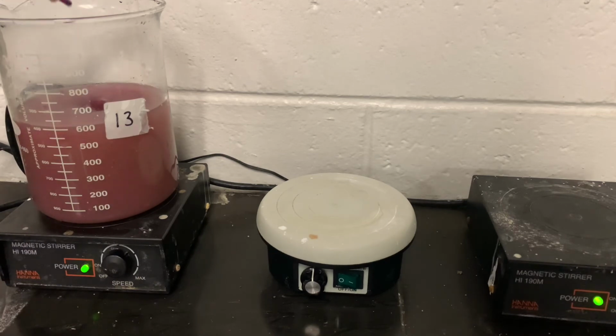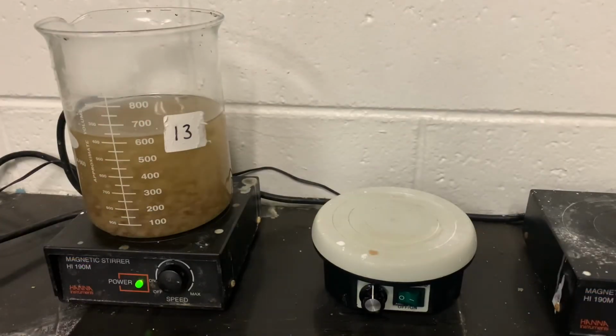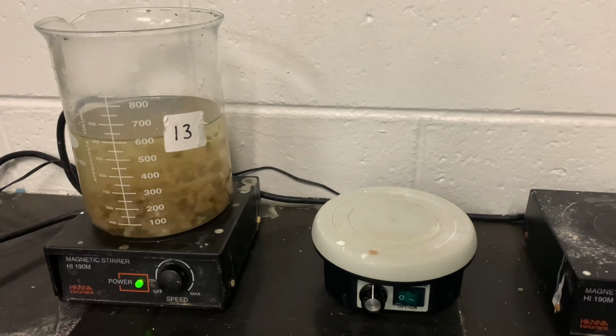It is turning pink, so that's a good sign. We'll see if it stays pink or if it gets all used up. All right, you can see after 15 minutes we did get a color change. I did add a little bit of a flocculant. It's an anionic flocculant, which the customer does use. And this was just so that I could get some separation between the solids and the liquid when I pour my sample off into the 25 ml vial. For the chemets test, I don't want it filled with solids.